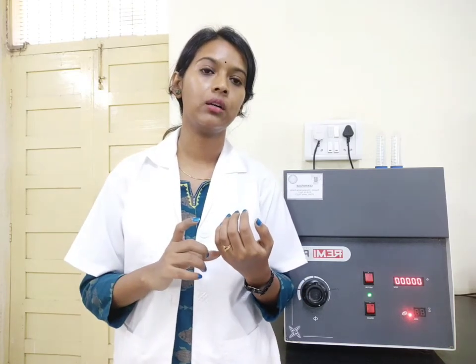To talk about the basic principle of a centrifuge: it actually works on the sedimentation principle. That means, depending on the components of the sample that you are putting inside, and depending on the density of those components, your sample will get separated. The food particles present in the sample will settle to the bottom because their density is heavier, and the solvent in which you have extracted will float on top because its density is lesser.